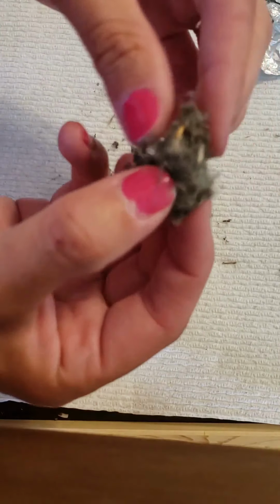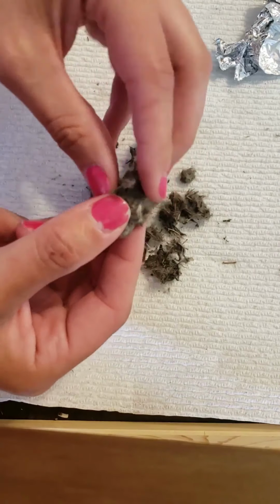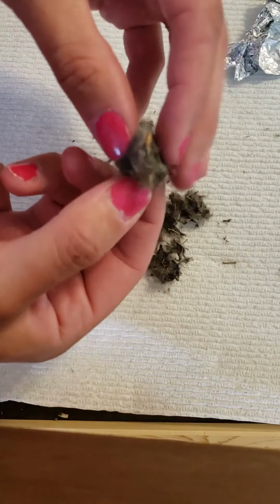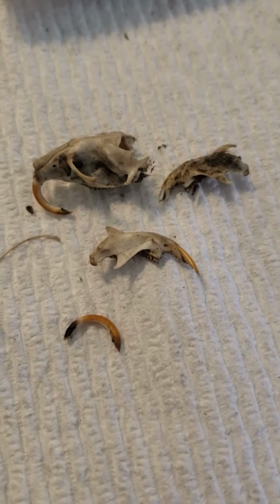Look if you can see. I'm gonna try to focus it. That yellow and that yellow, those are teeth, and it looks like this skull is together. Like, the mandible and the top skull are still together. So I'm gonna try to clean this up a little bit, and then I'll be back. All right, guys.